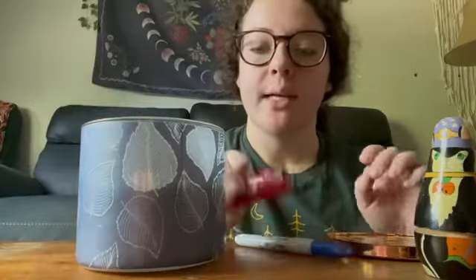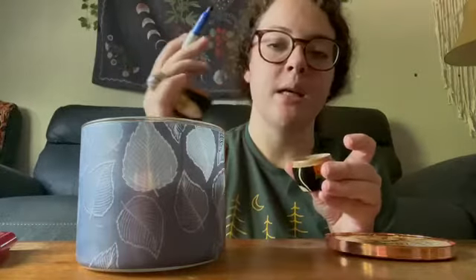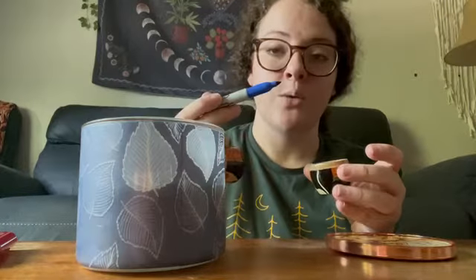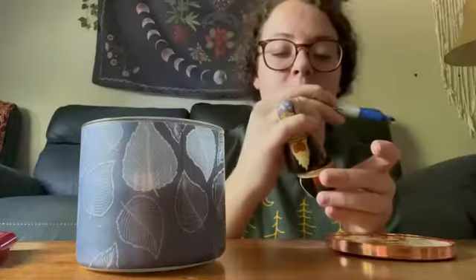The first step is to light the Bunsen burner and then get your inoculating loop and hold that over the flame for a couple seconds to sterilize it. Next you get your test tube, take the lid off with your pinky and hold it there, flame the mouth of the tube for a couple seconds, and then dip your inoculating loop into the test tube to get the sample of your original culture. Then flame the mouth of the tube again and put the lid back on and set that aside.